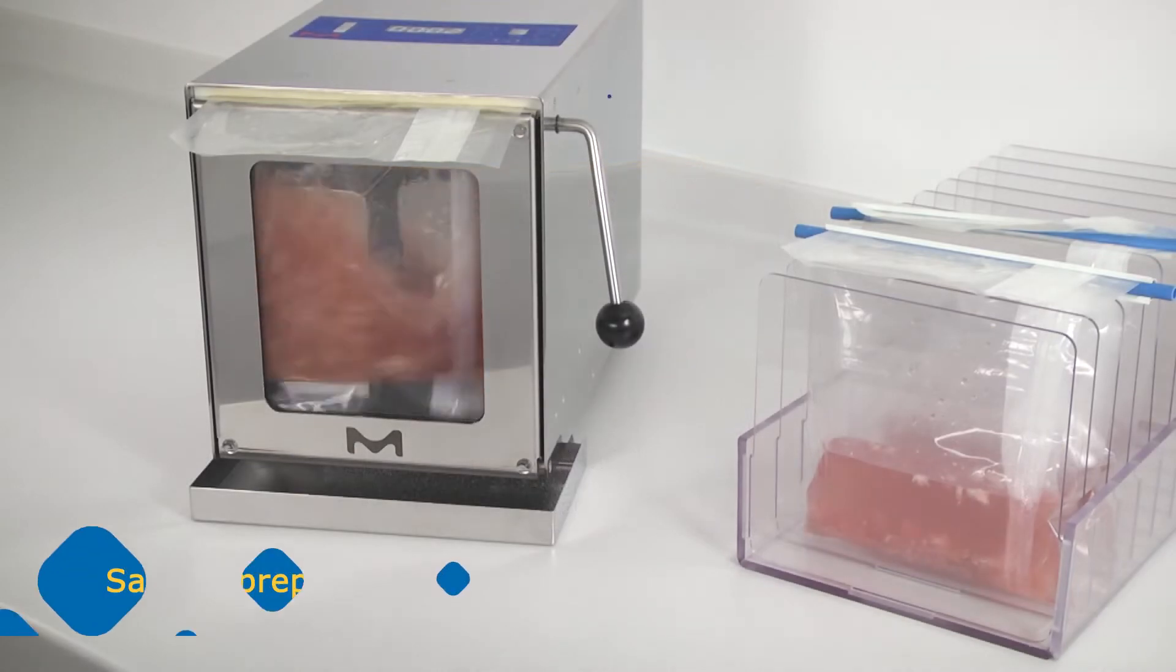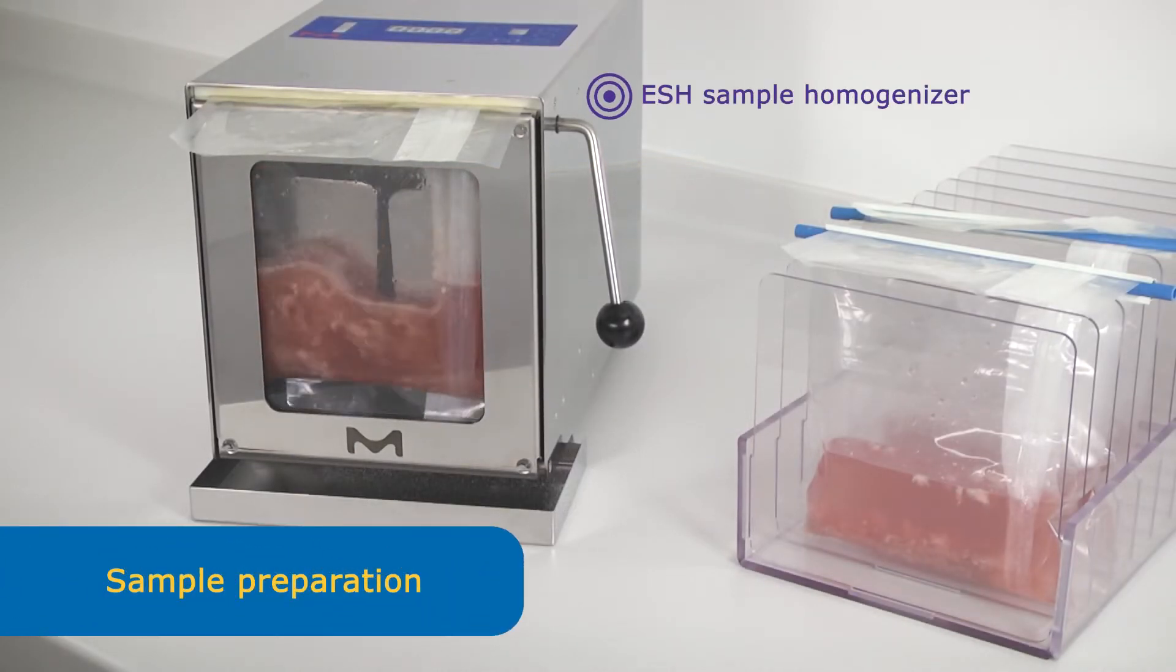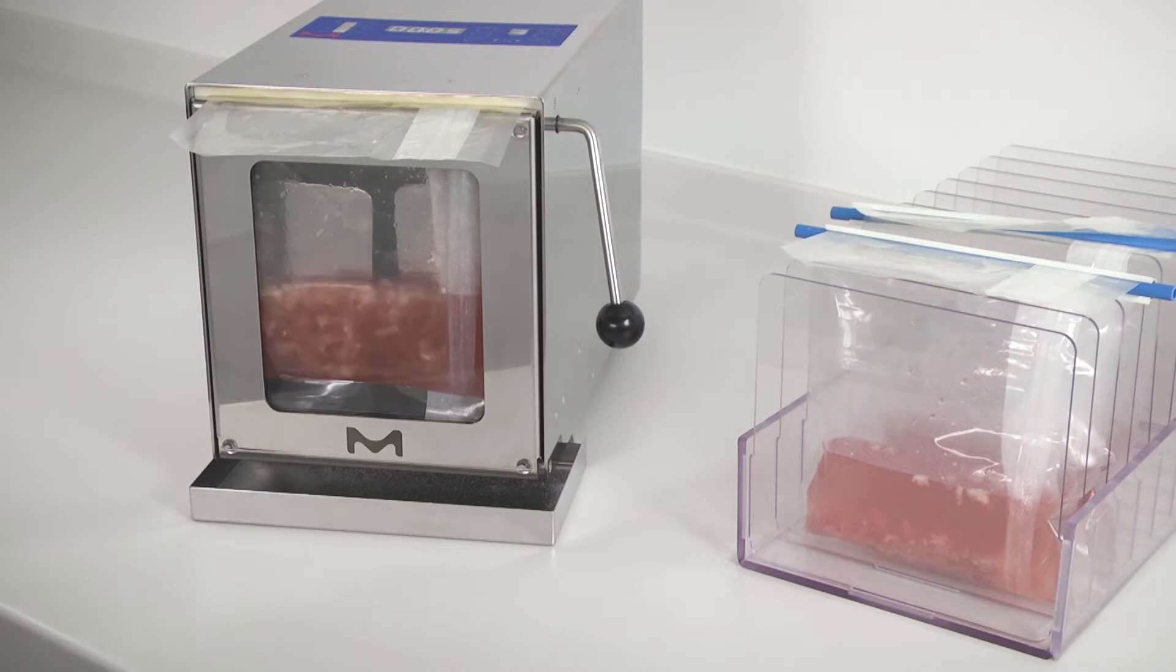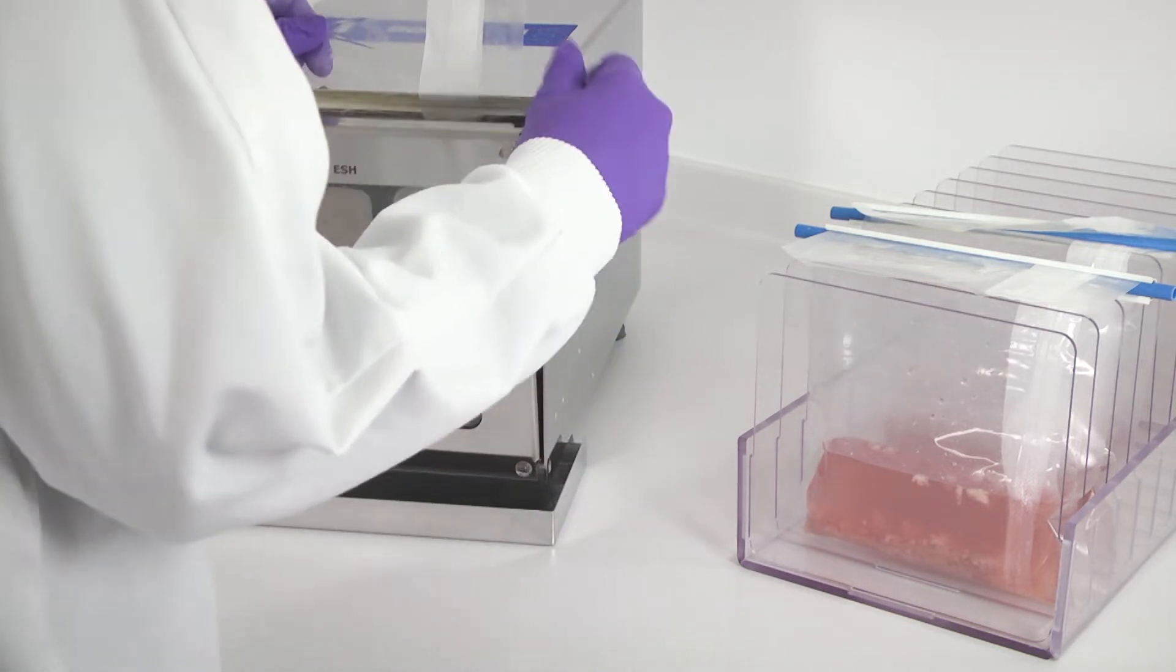Prepare your sample, for example, with a blender or our sample homogenizer. Then follow the recommended procedure for sample preparation.